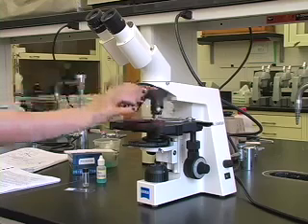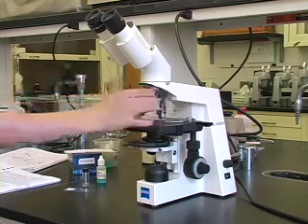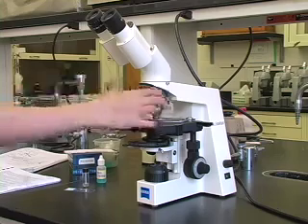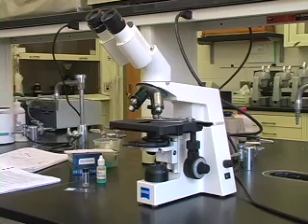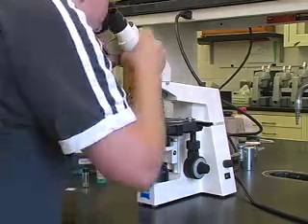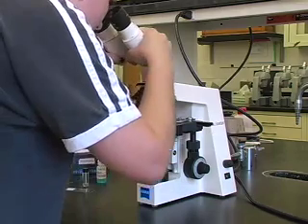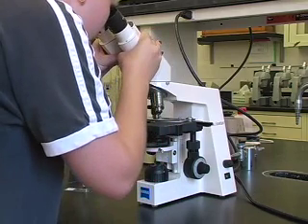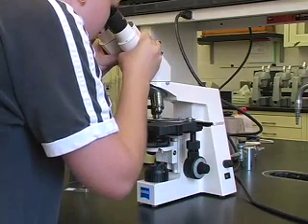Rotate the nosepiece until the ten-times objective is perpendicular to the stage. Make sure it clicks into place. Adjust the eyepieces so you see a single circle of light rather than two.